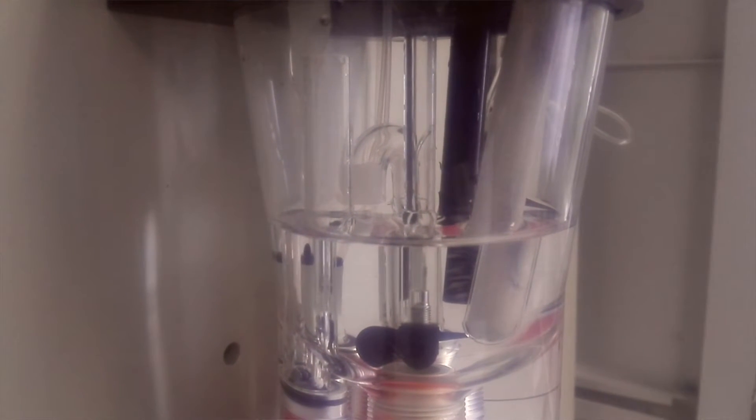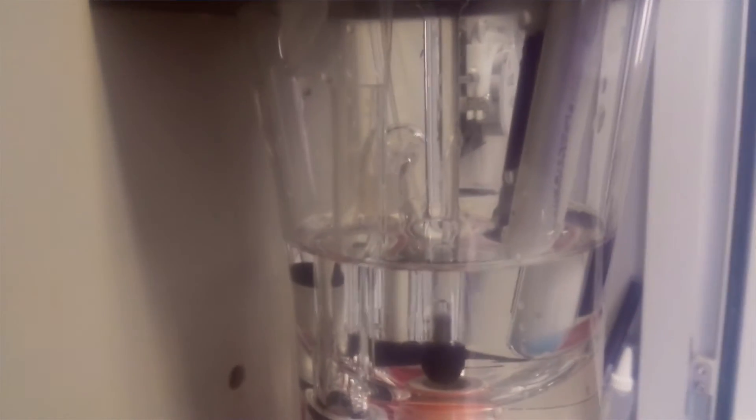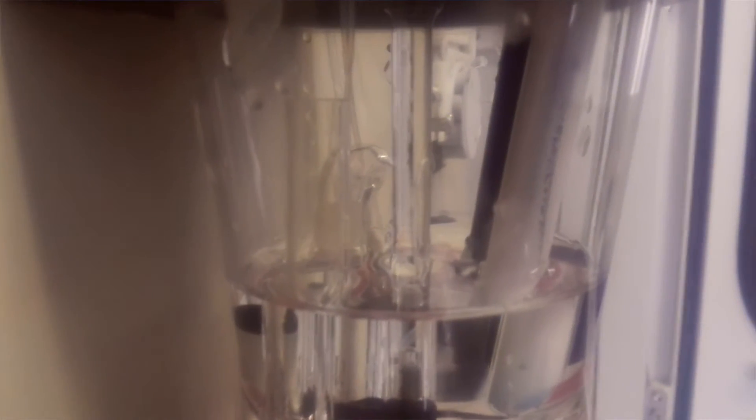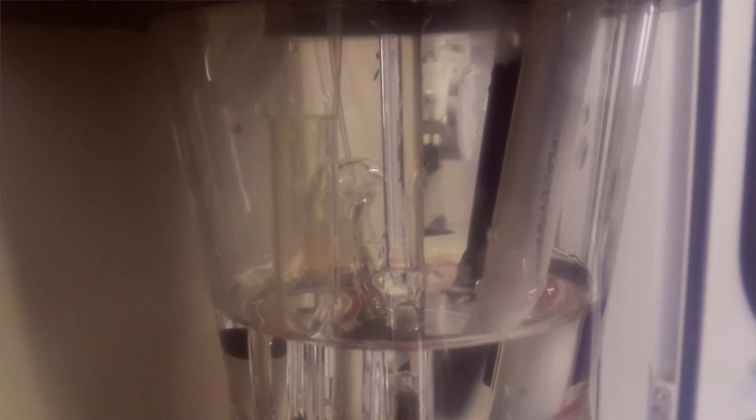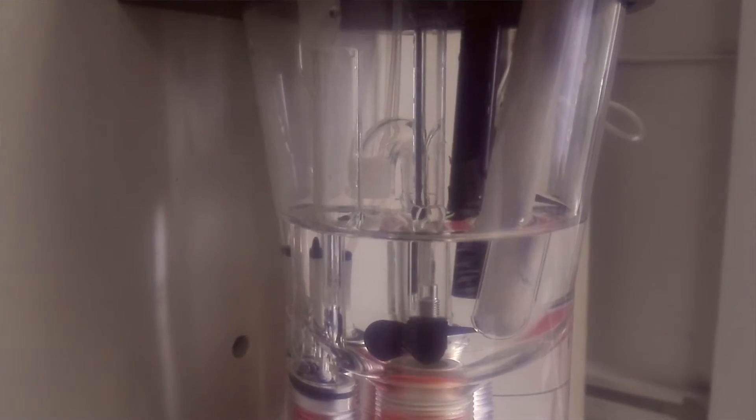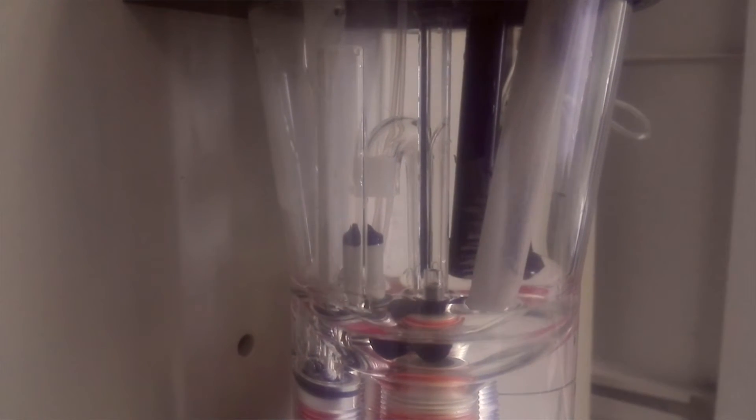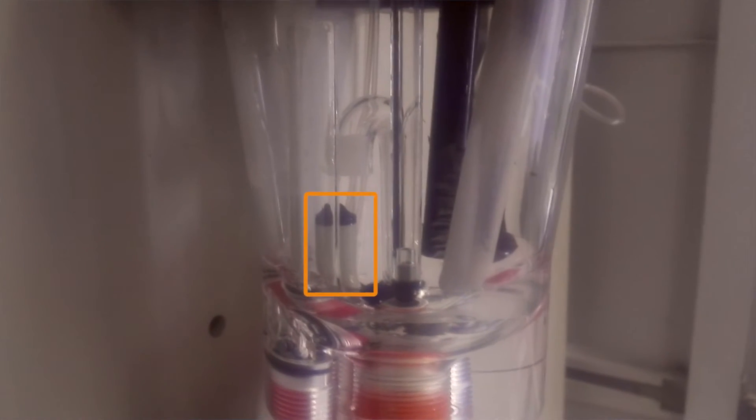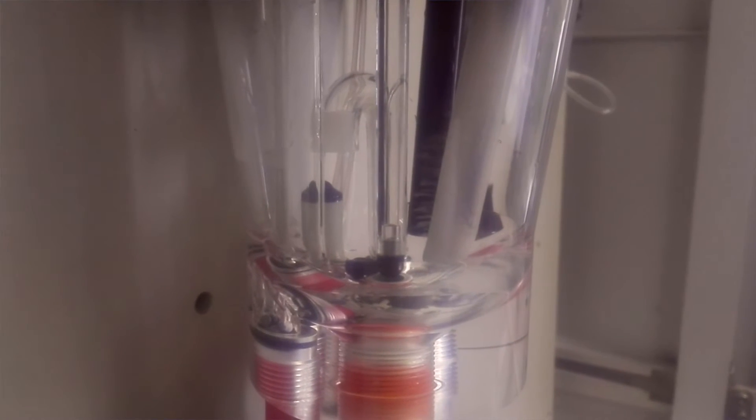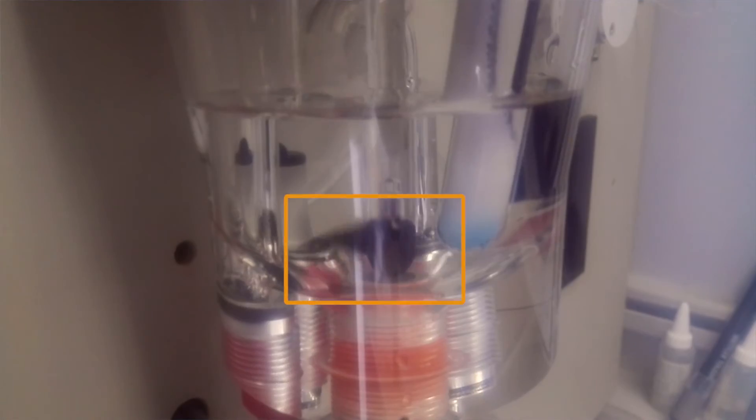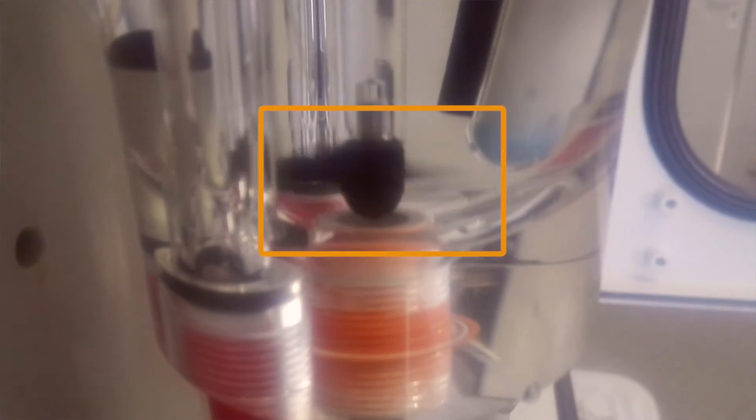It is used to adjust sample volume accurately. The distance between the mouth of the overflow tube and siphon should be more than 2 cm if you want the siphon to work properly. Between the overflow tube and siphon tube, this is the level sensor which ensures the proper level in the reactor chamber. This is the stirrer or mixer to mix reagent properly during titration. On the top side of the reactor chamber, there is the stirrer motor.